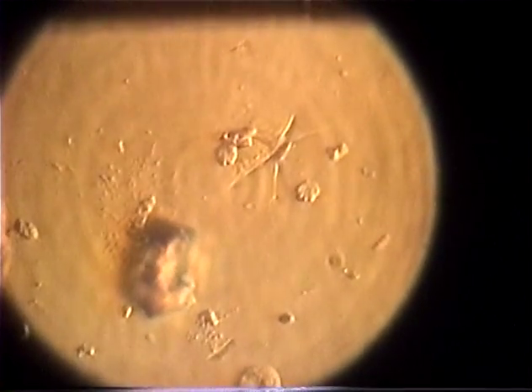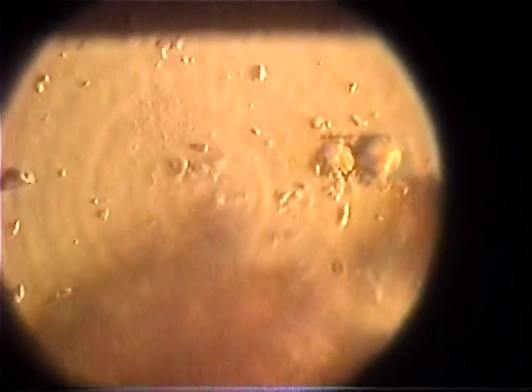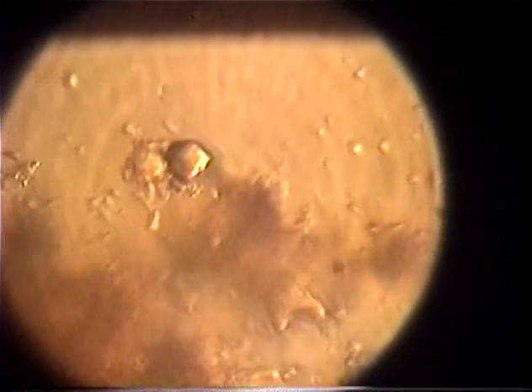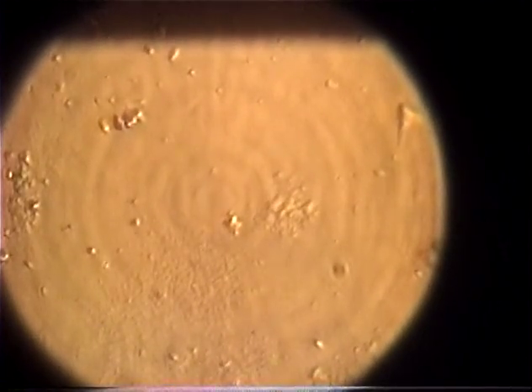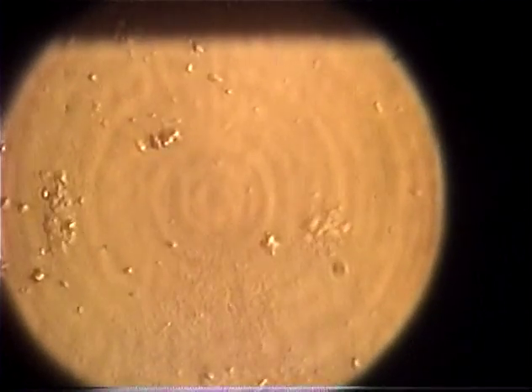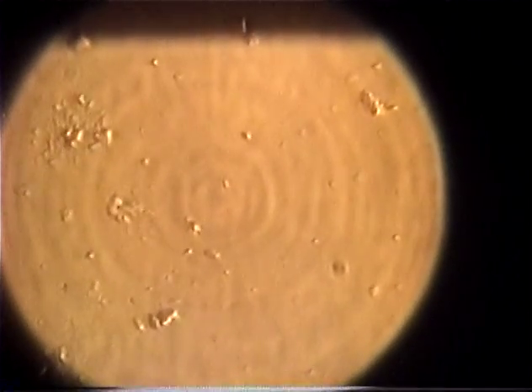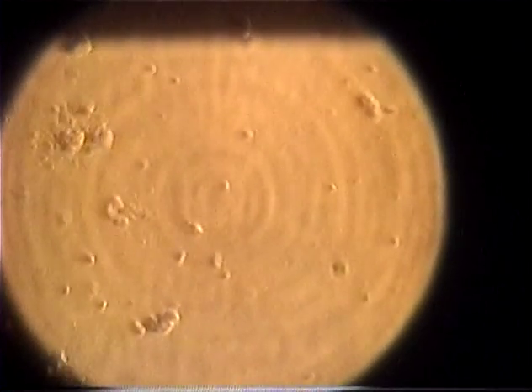All right, we'll do that on the next one. Now, there's one of those things that we saw earlier, but it's off by itself. So they might be parasites in the water, and they might find living things and get inside them, just like when mosquitoes inject you with malaria. It has a little protozoa, no bigger than what we're looking at now, that thrives in your bloodstream as a parasite. What were those things? These are awfully small.